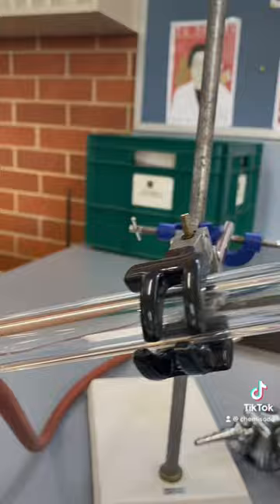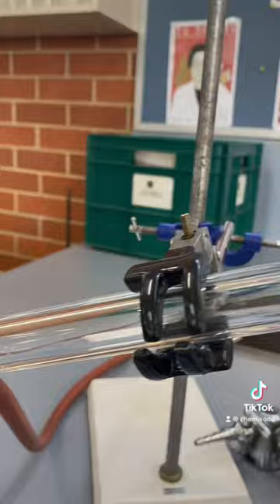In order to obtain a usable biofuel, we need to do distillation, which is using this apparatus here.